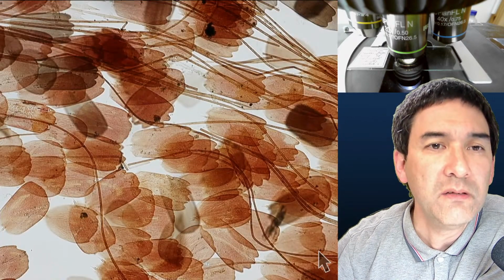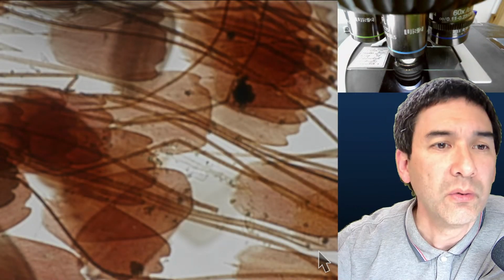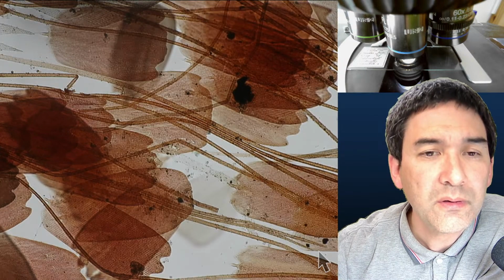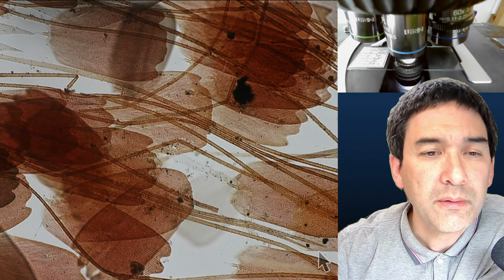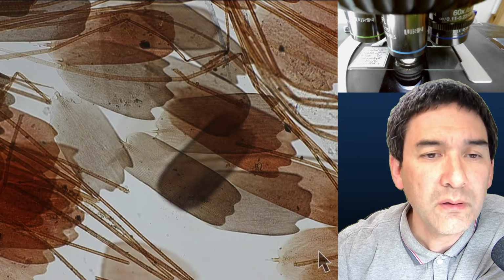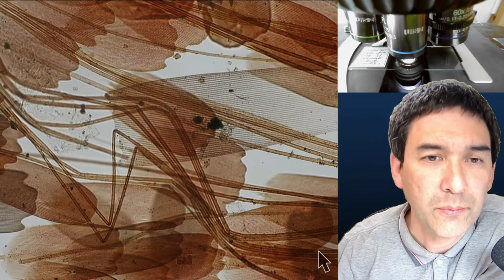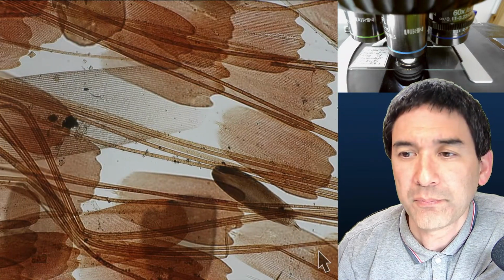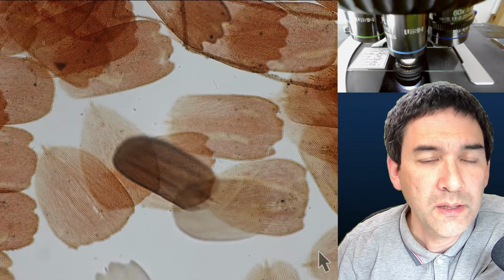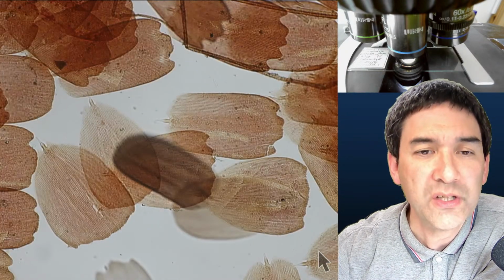I don't know if these are indeed vessels or something. We have to zoom in here. I was already worried that this could be some kind of, I don't know. Maybe, yeah. Could be. I don't know. Yeah. In any case, if you see those structures in dust somewhere or in some water samples, then you know that these are from the scales of a butterfly. Yeah. Helicon Focus is quite a nice program as well, which combines different images of a different focus into one clear image.